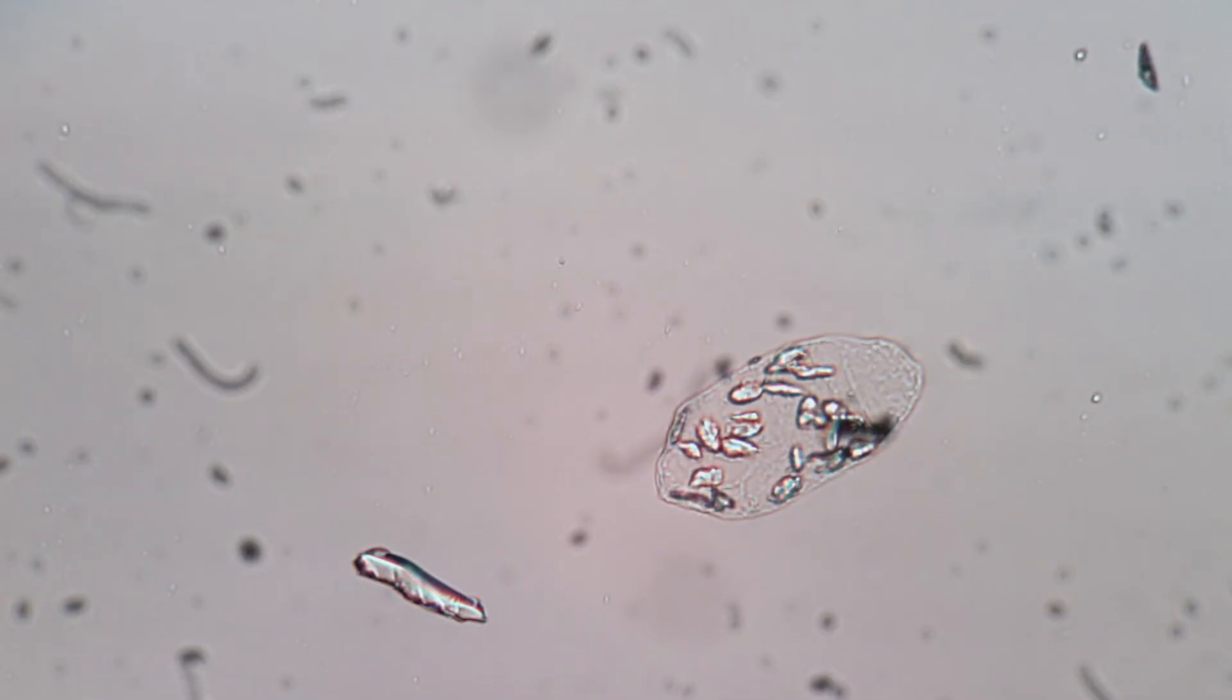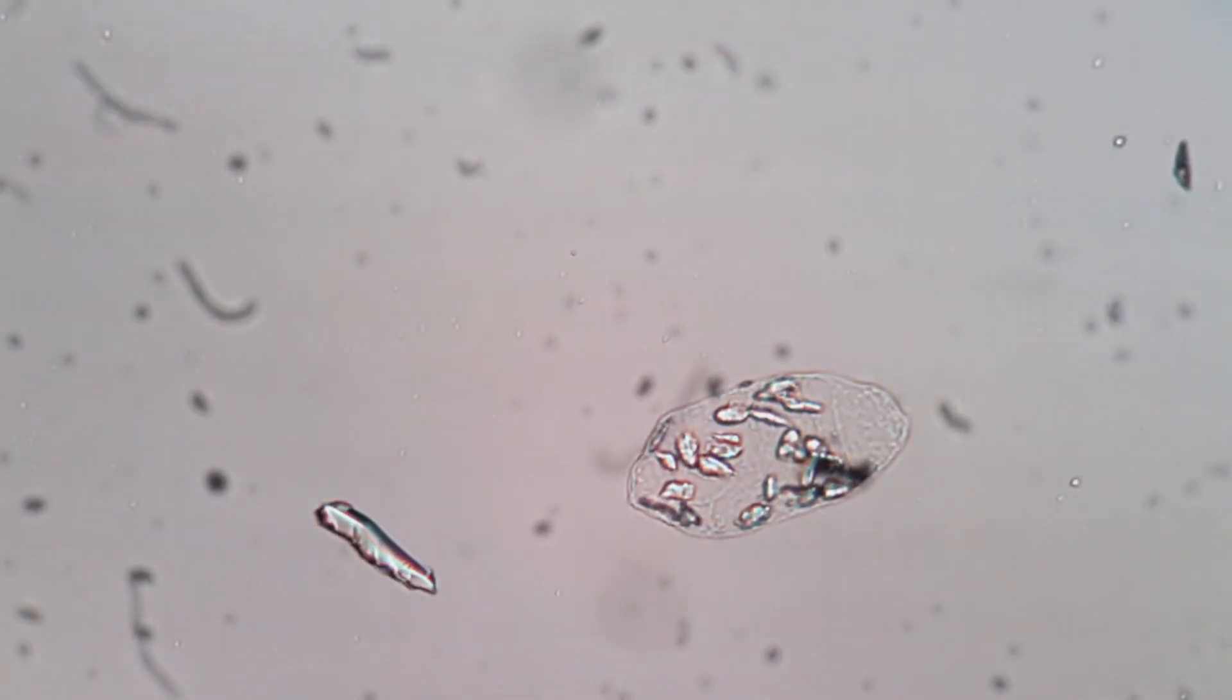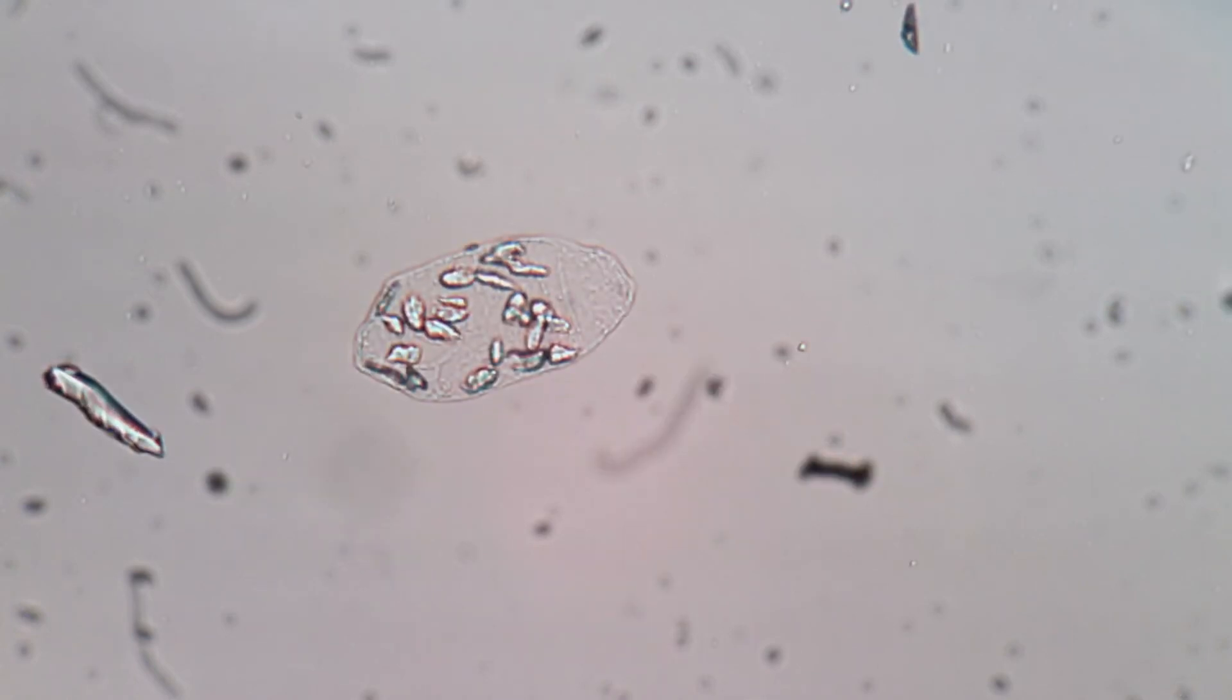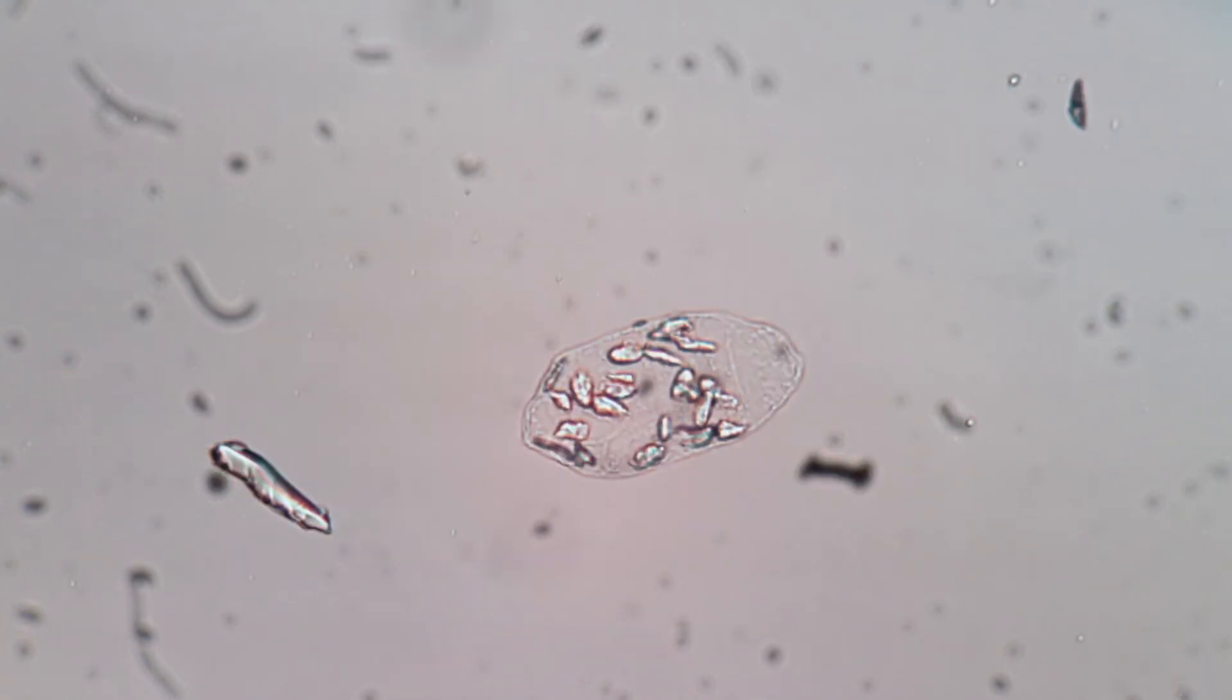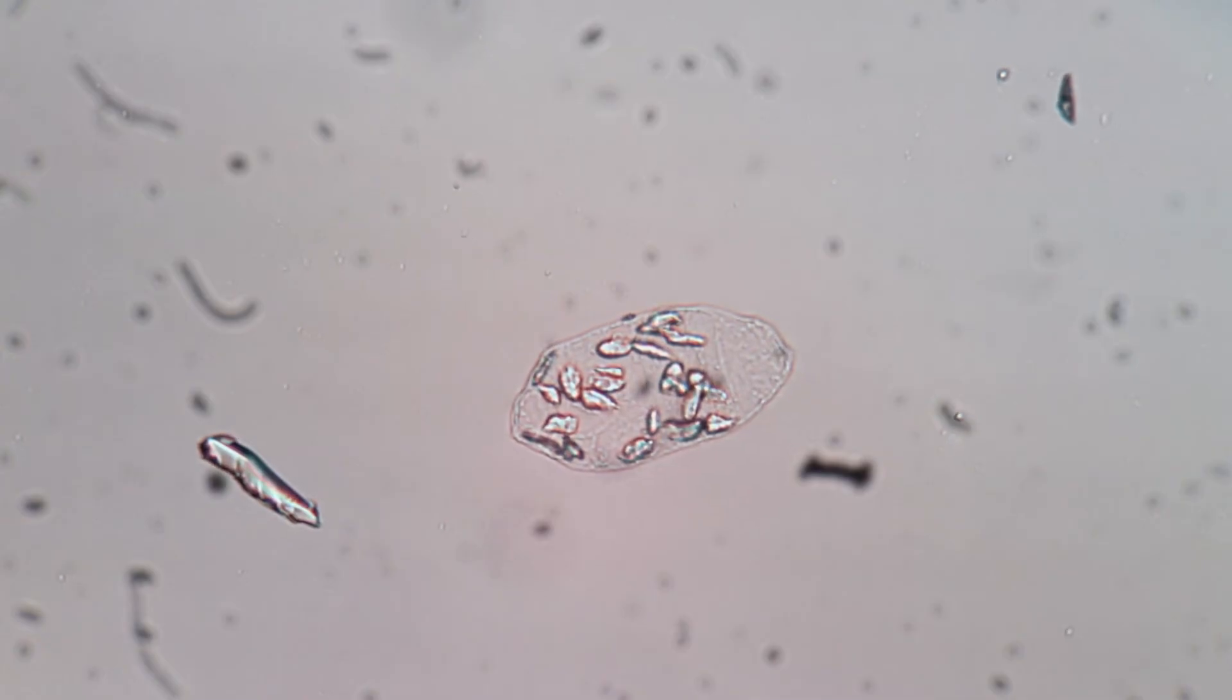It is impossible to avoid air bubbles completely in this preparation, but you may need to make another slide if there are large pockets of air or numerous air bubbles. A representative banana cell will be isolated on its own and have many large starch grains.